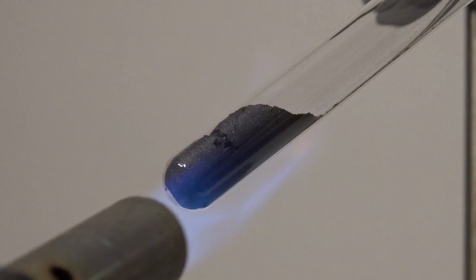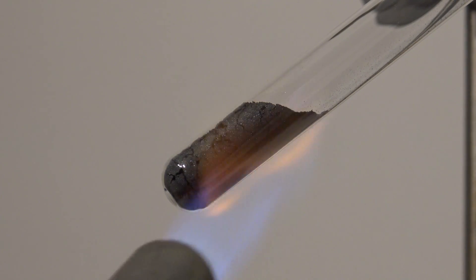The surface of the glass and maybe even the silicon have traces of water on them, which react with the calcium. So the gas must be hydrogen, which tends to ignite.